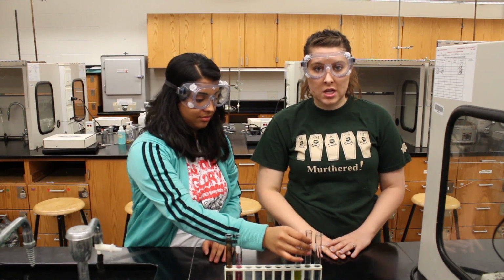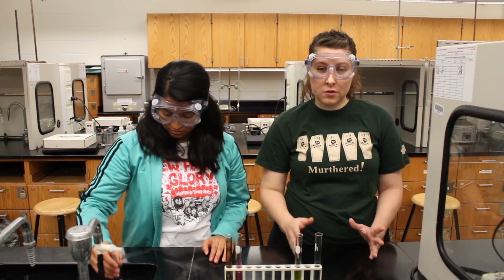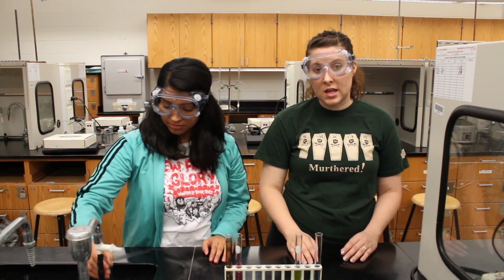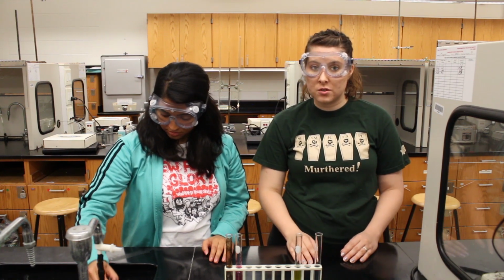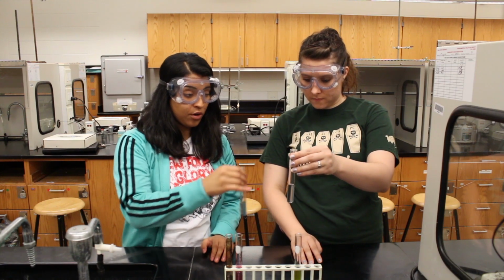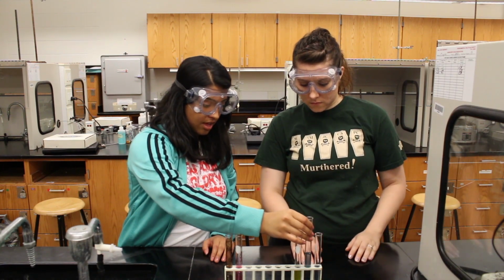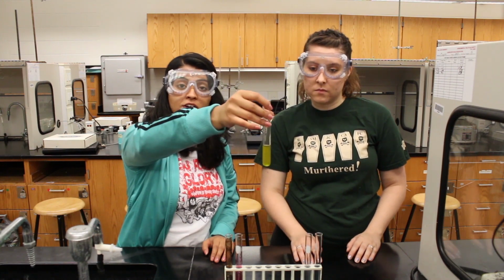If you get any on your hands, be sure to wash your hands immediately. Now, you'll know if the solution's undergone oxidation because the yellow color of the chromate ion will change. Here are the results for your primary, secondary, and tertiary alcohols.